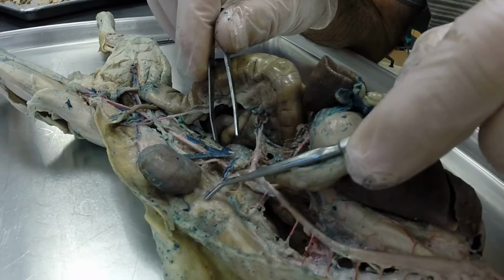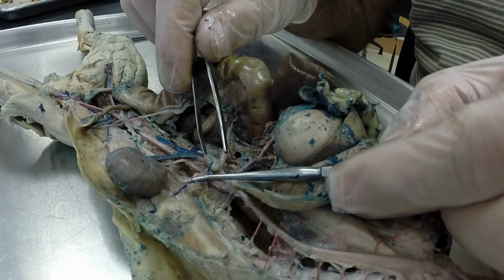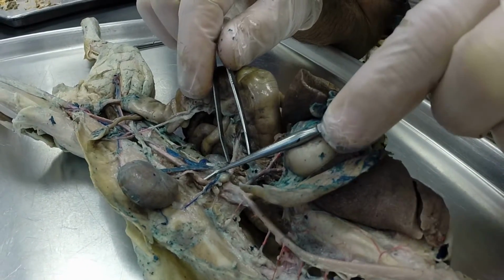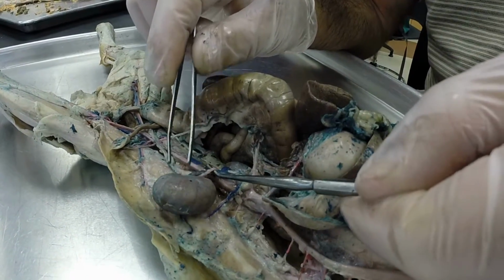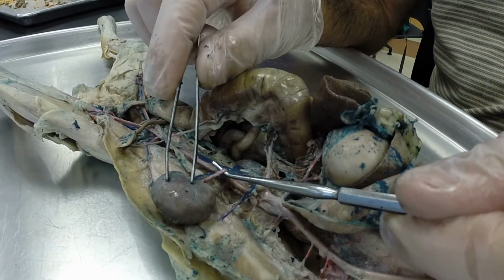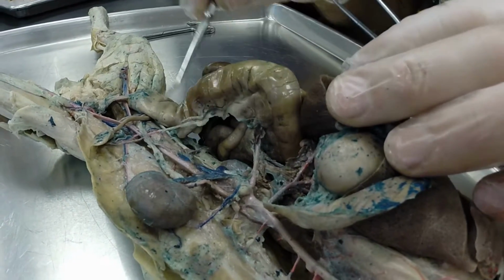And it's also going over here to the lumbar region, so this is your adrenolumbar artery. This would be a left adrenolumbar artery. And then we are back on our descending abdominal aorta right there. The next branch off of it is the renal artery going to the kidney, and this would be a left renal artery.